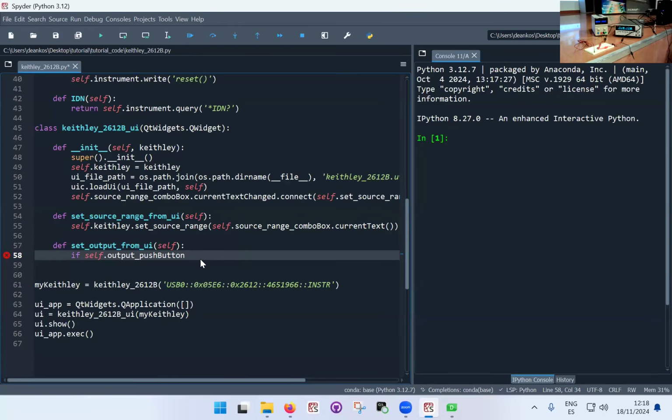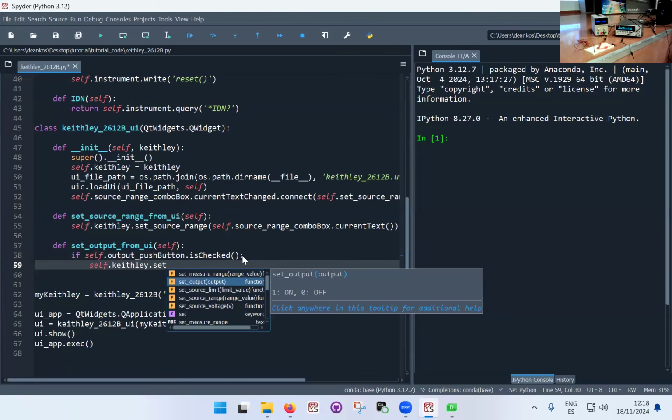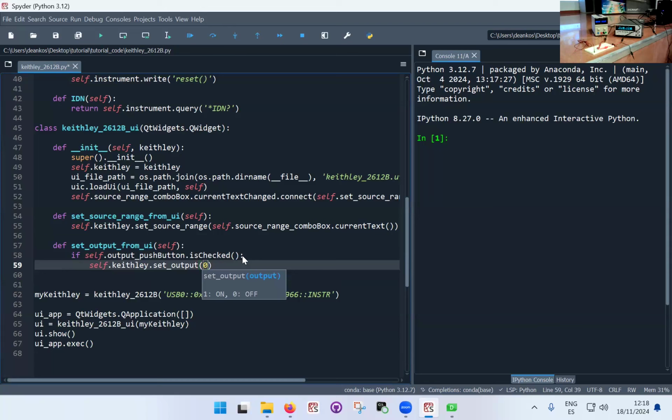If self.output push button dot, and here is the keyword is checked. Okay, so when this executes, the Python will look at the button and will see, is it checked or is it not checked? If it's checked, it's going to return true, and therefore the condition is going to execute. If not, we're going to go into the else case. So if the button is checked, go to self.keithley dot set output, and we turn it off.